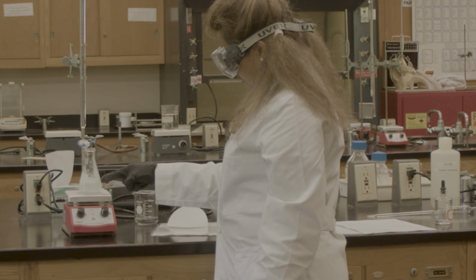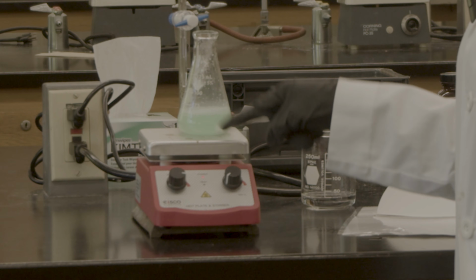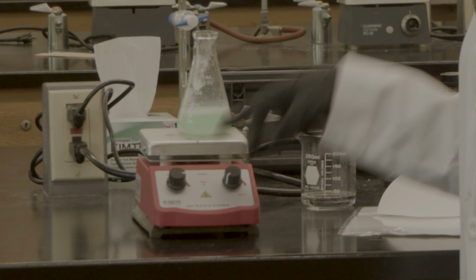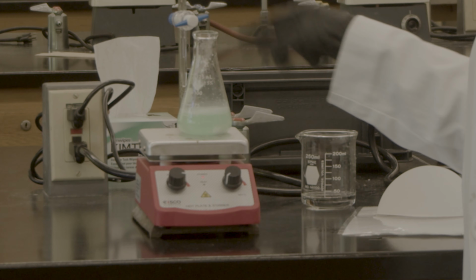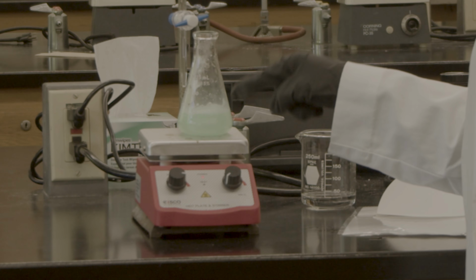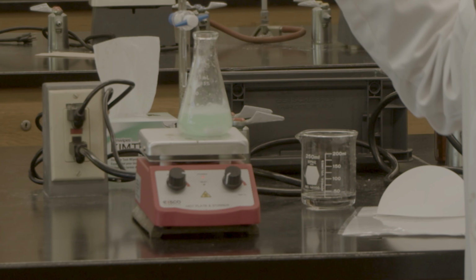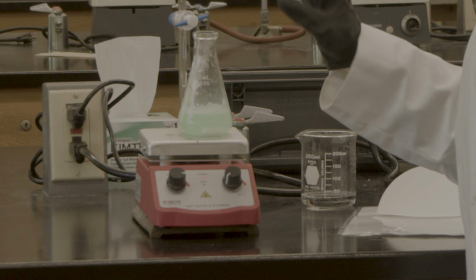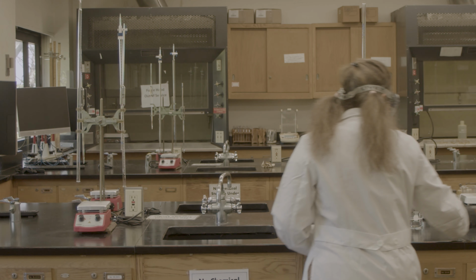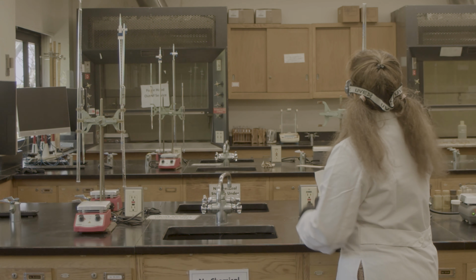You can see some bubbles, which is actually the carbon dioxide gas. This device is helping with two things: it's stirring and it can also heat it up. As it is stirring and I'm heating it up, the carbon dioxide gas is driven off, so I will do the titration only with the hydrochloric acid, not the carbon dioxide gas. I don't want the carbon dioxide gas to interrupt my titration. In the meantime, I'm going to prepare my burette.